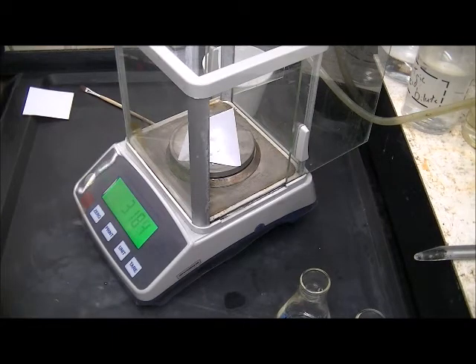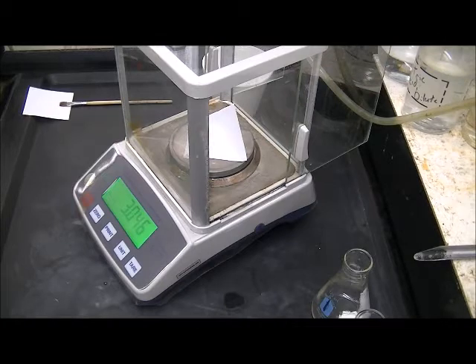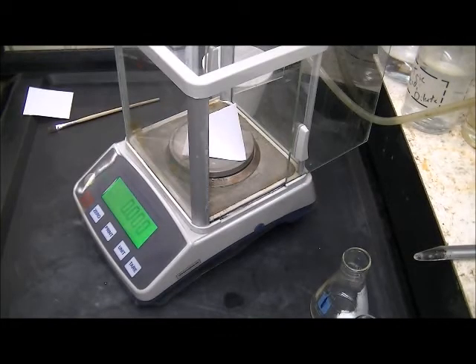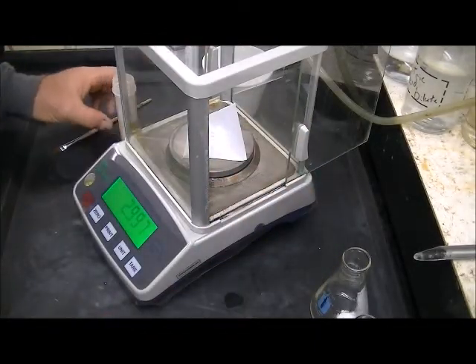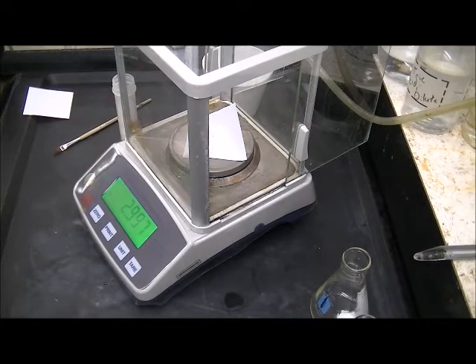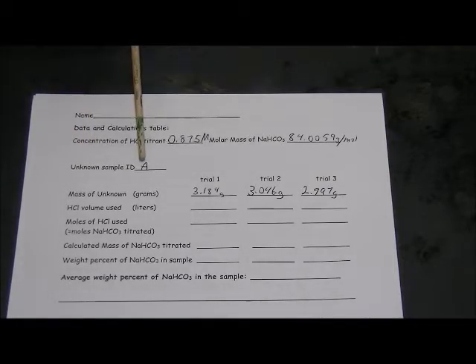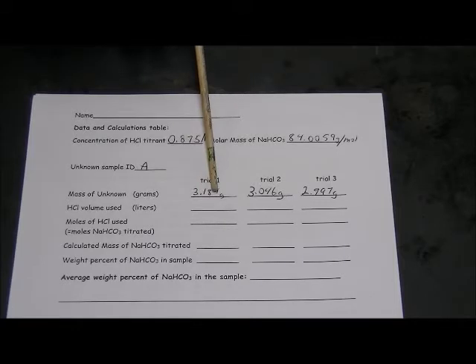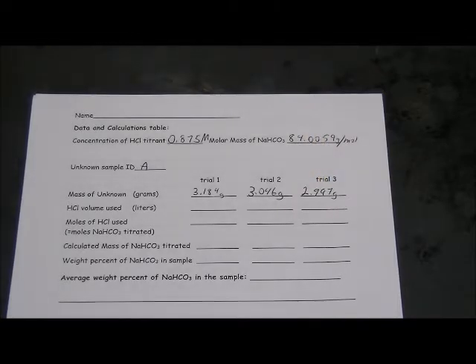So for sample number one I have 3.184 grams. There's 3.046. And the final sample number three, 2.997. So now we've weighed our first three samples for this lab. This is sample A. 3.184 grams, 3.046 grams, 2.997 grams. That is our three samples.